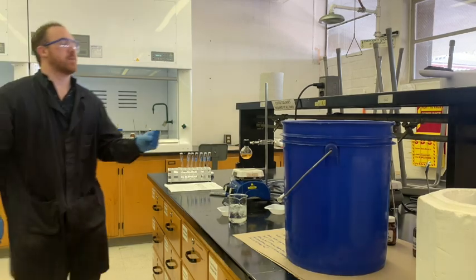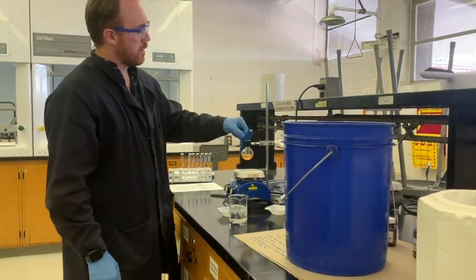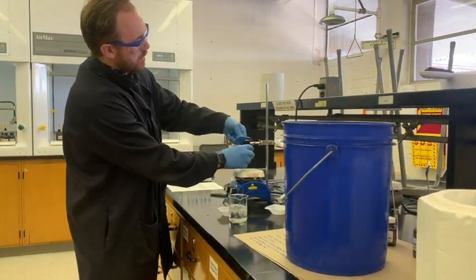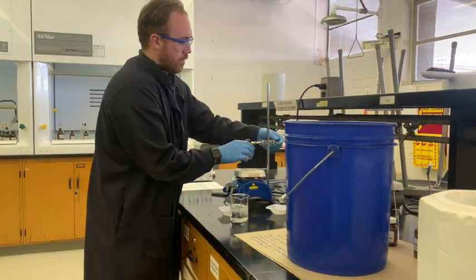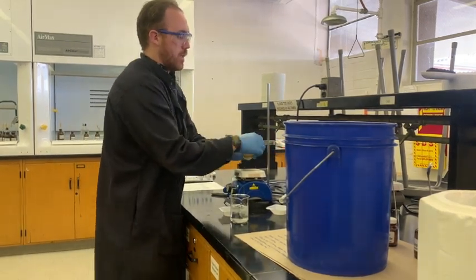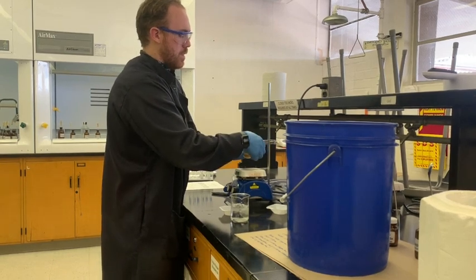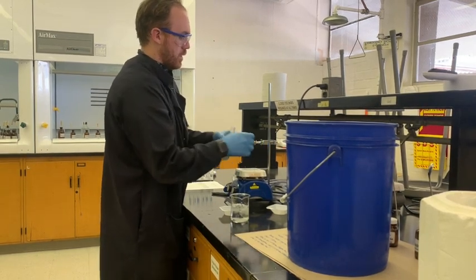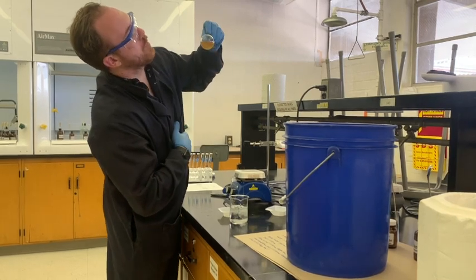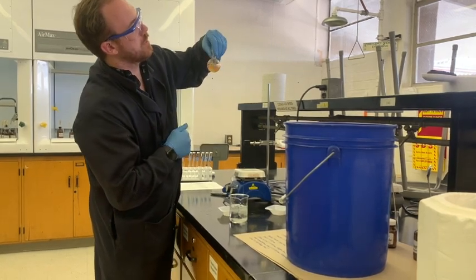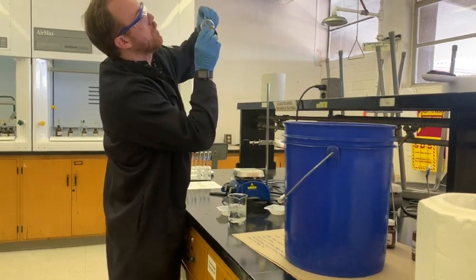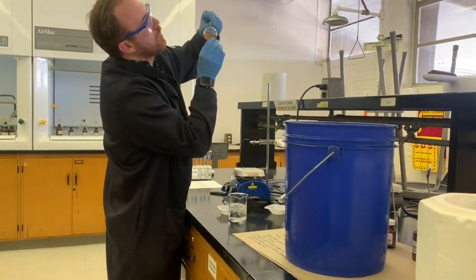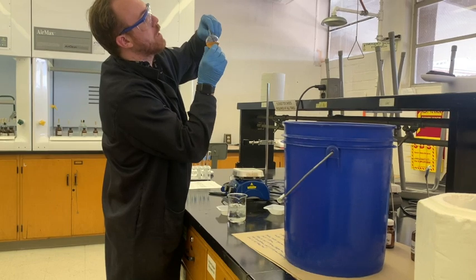I'm just going to get a nice big magnet, pull it down like that, and unclamp this. Already got the precipitate working in there. A little bit of water lowering the solubility. It's almost like a tangerine color here.